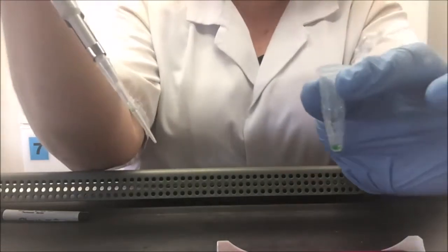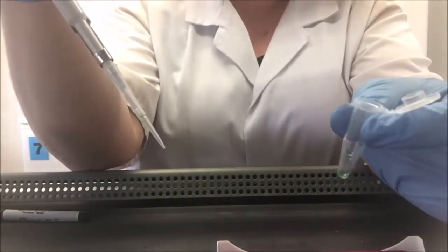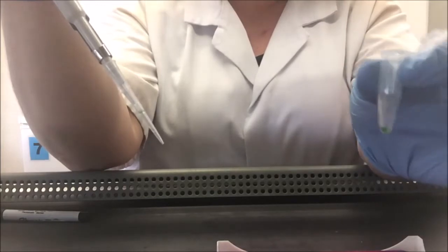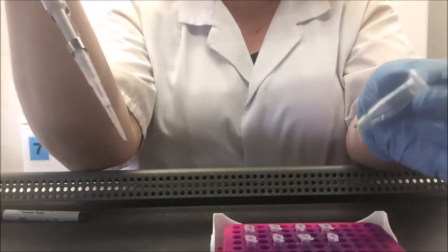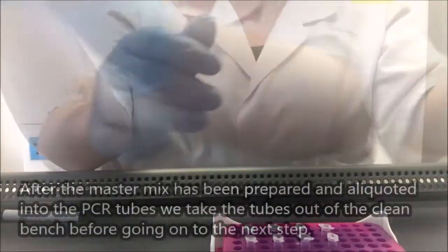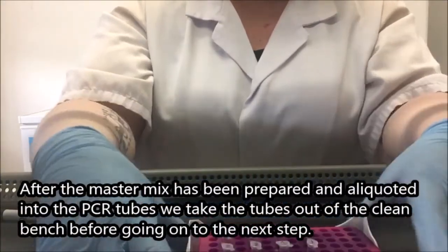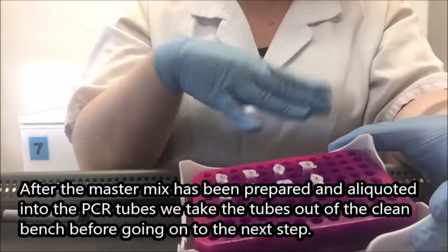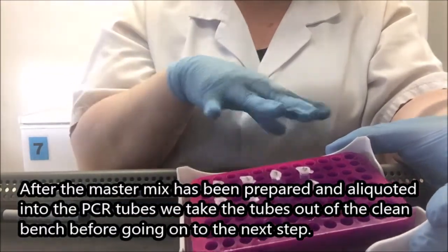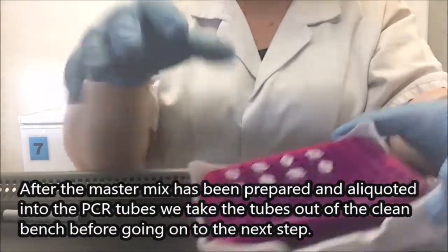And there we've got a little leftover. We knew that was going to happen because we put in enough for 9 samples but we only have 8 samples. My master mix leftovers can now go in the bin. And I'm now going to take my cold aliquots of master mix out of the clean bench, because I need to add my DNA and I don't want to introduce DNA into this environment.